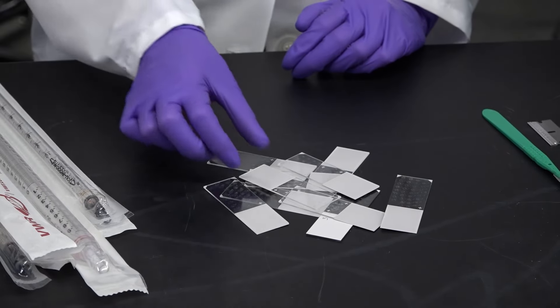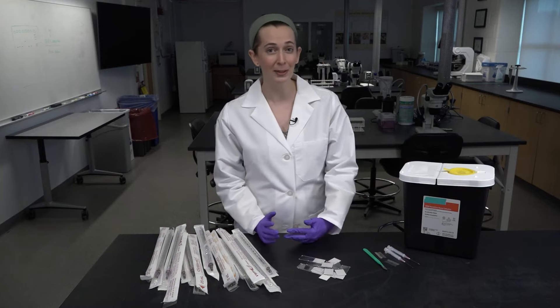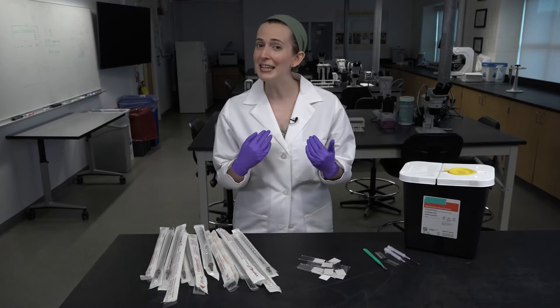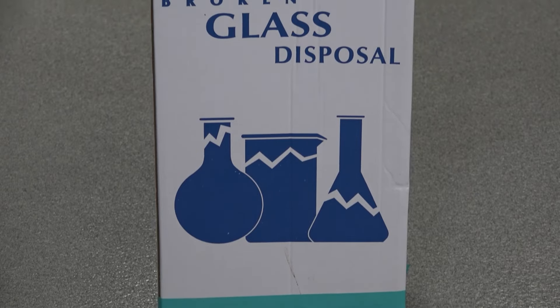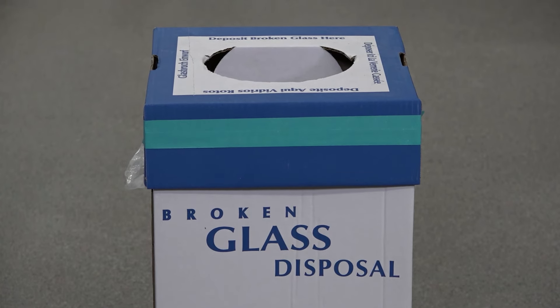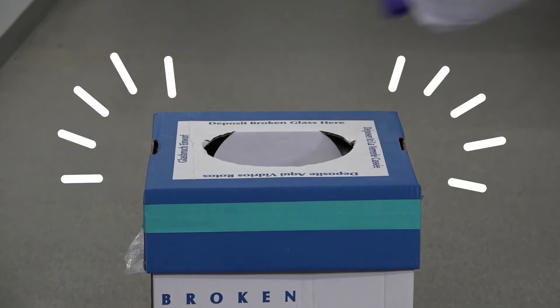As a biologist, I go through a ton of microscope slides and serological pipettes for my research, which eventually need to get discarded. And every scientist I know, including me, has broken at least one piece of glassware during their time in the lab. Enter the glassware box! It has a very handy cardboard construction suitable for all your glass disposal needs that won't get punctured by any stray shards. Glass that goes in here needs to be clean — it eventually winds up in the regular trash or recycling, so it can't be contaminated with any hazardous waste.